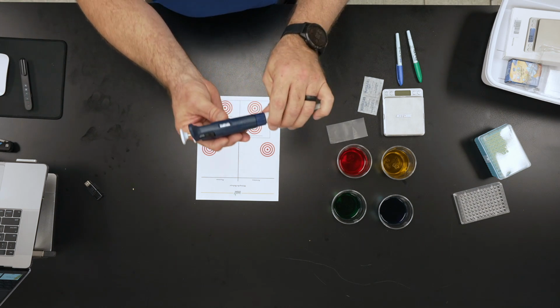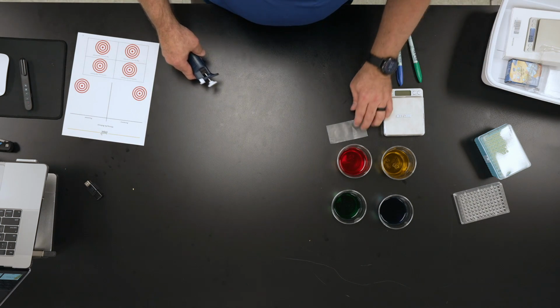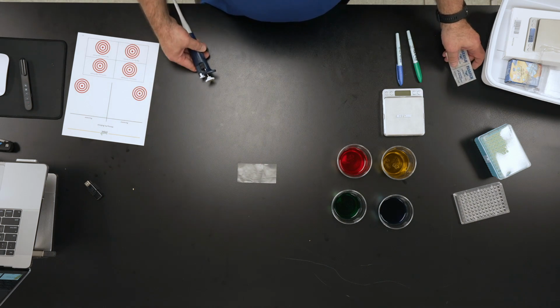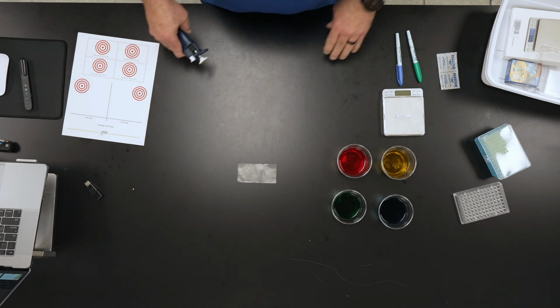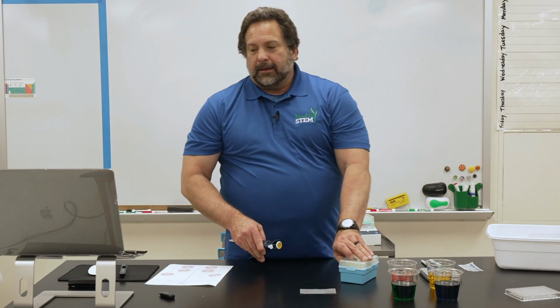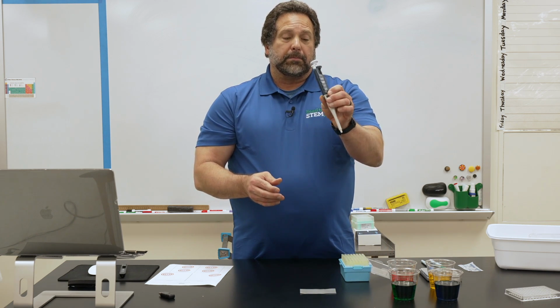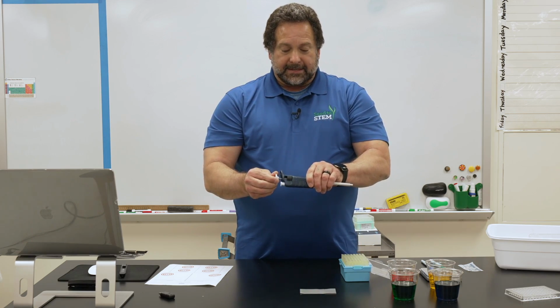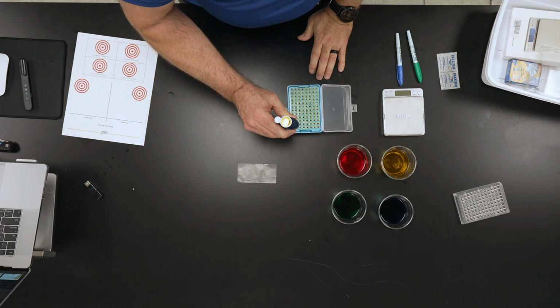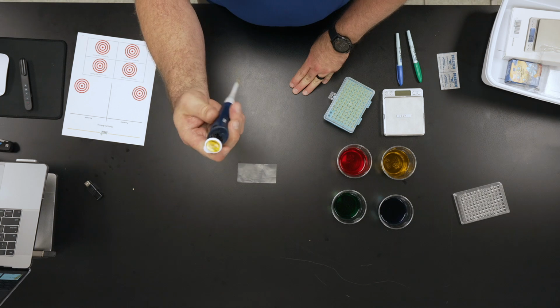First step is how are you going to use something like this. To use something like this, we're going to use a little piece of wax paper. It's essentially parafilm. You could use wax paper, something where the water will not be absorbed by the material it's on. The next step is to get a pipette tip. There are certain tips that will fit this micropipetter. I've set this up at 60 microliters. I'm going to put a pipette tip on this. And now I've got the pipette tip and the plunger is here.